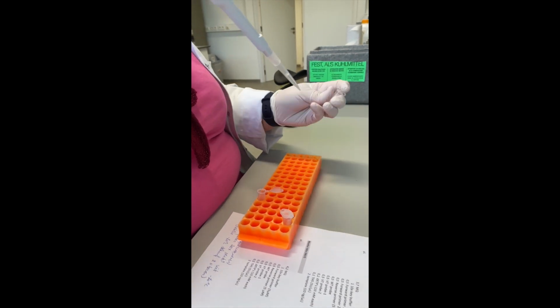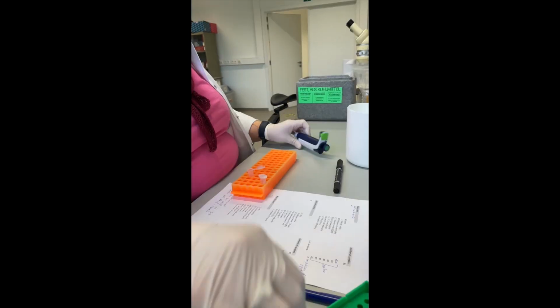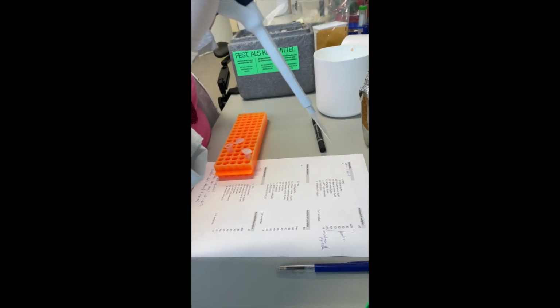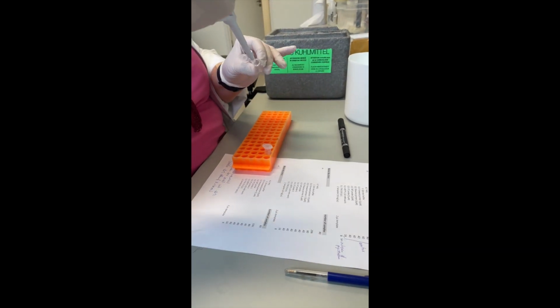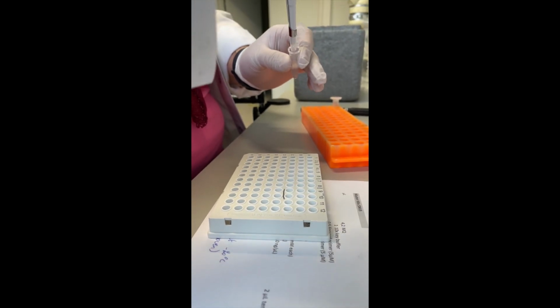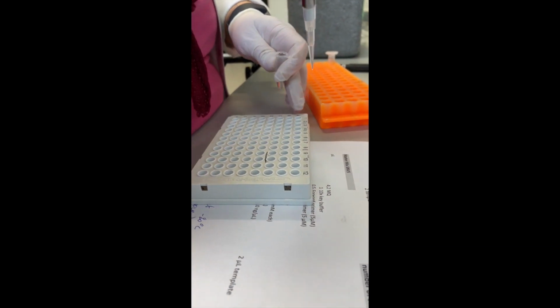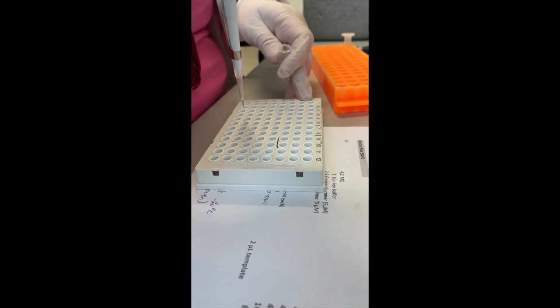First of all, a master mix is prepared without a template for the specific SNP you want to test. After distributing the master mix over the different sample wells of a microtiter plate, the sample is added.